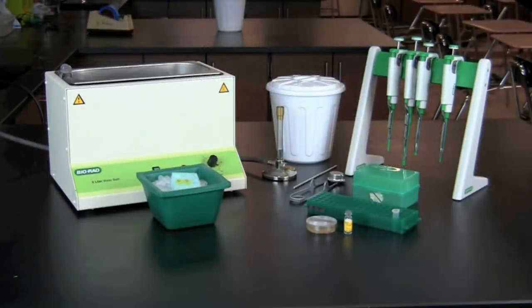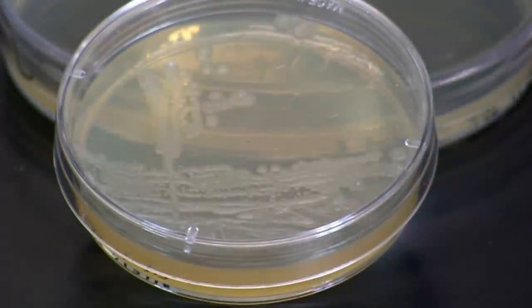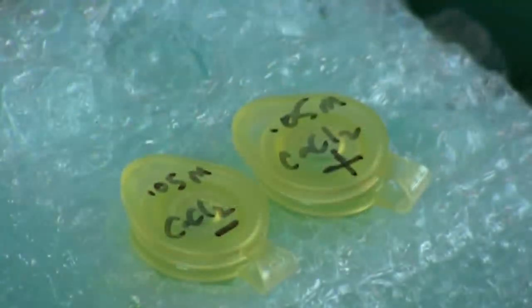In this video, you will learn how to perform a bacterial transformation. E. coli HB101 bacteria will be transformed with pGLO plasmid using a calcium chloride transformation. To start this activity, you will need an LB agar starter plate, streaked for single colonies of E. coli HB101, and 2 microcentrifuge tubes, each with 250 microliters of 0.05 molar calcium chloride or transformation solution. One of the tubes should be labeled plus and the other minus. Both tubes should be kept on ice.